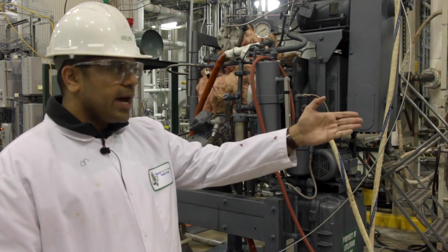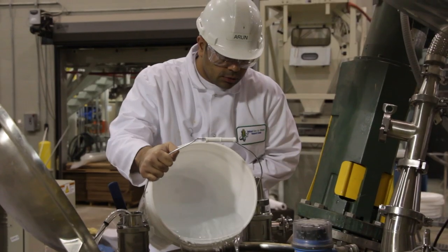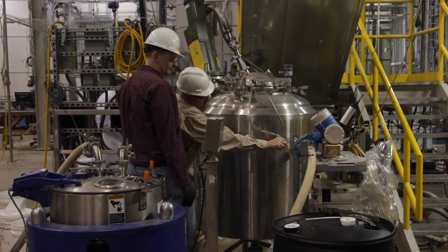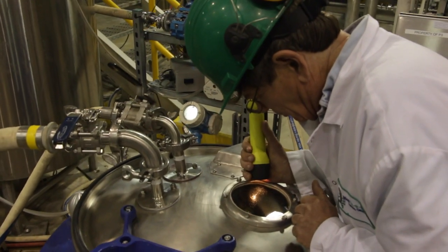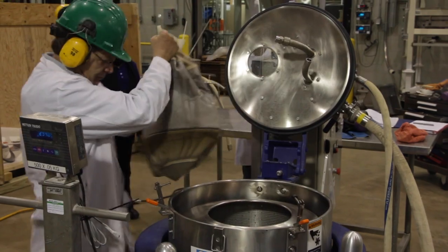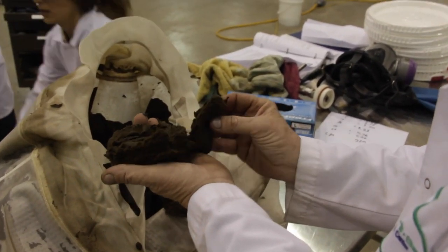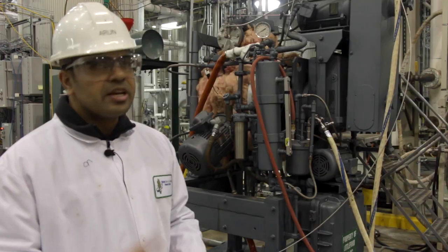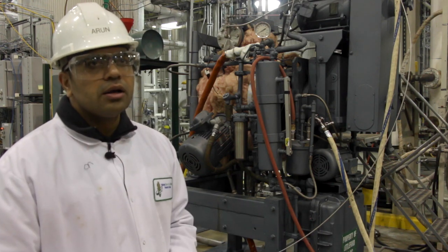What we are going to carry out here is to mix the material with hot water, add a little acid to bring its pH to neutral, and then separate it out using the centrifuge we have over here, so that the solids can be used to extract sugars and convert them into ethanol or any other product of interest, and the remaining waste compounds can be discarded. That's the process we are going for with this.